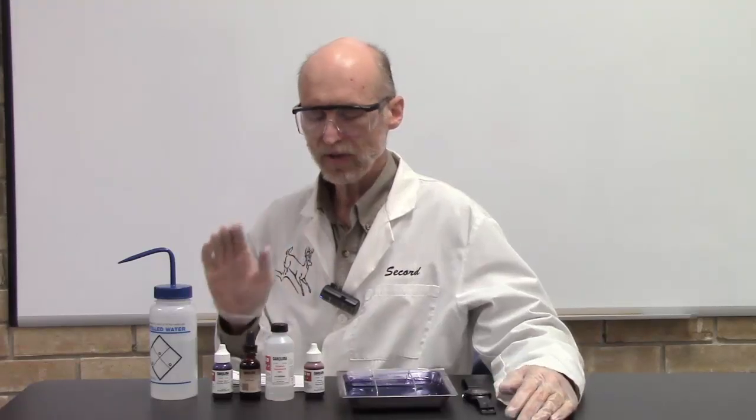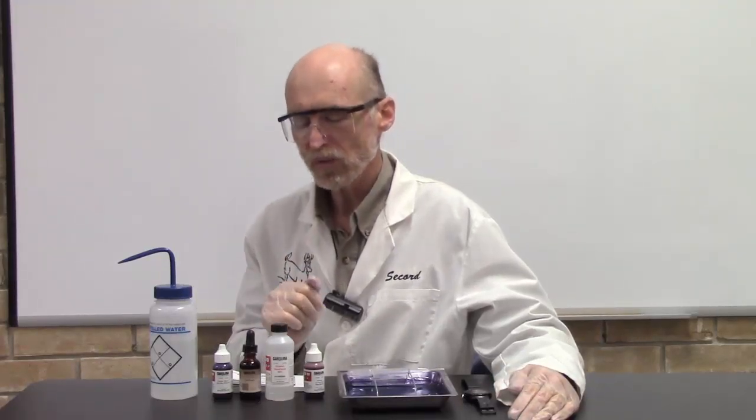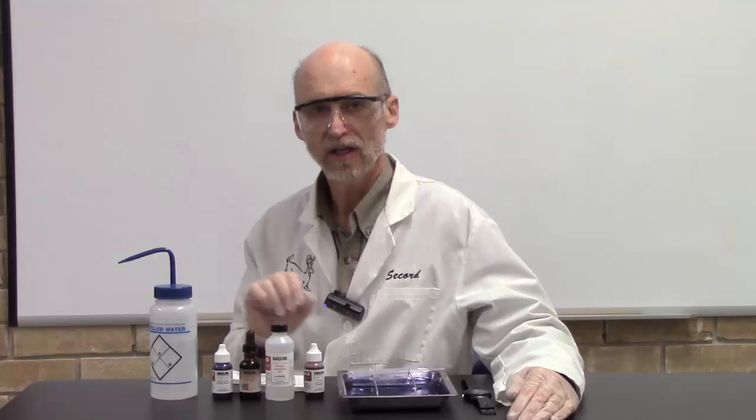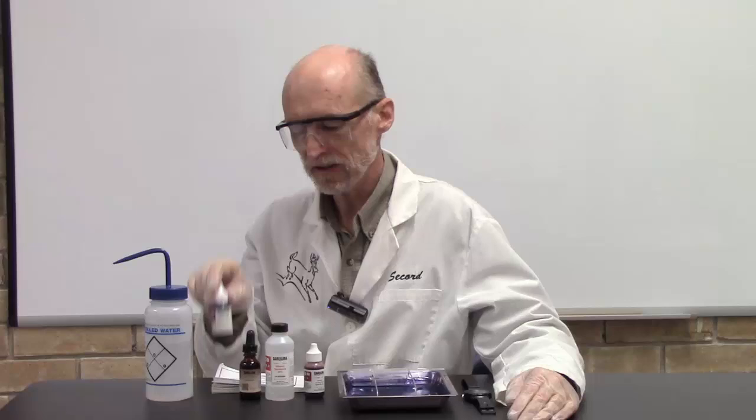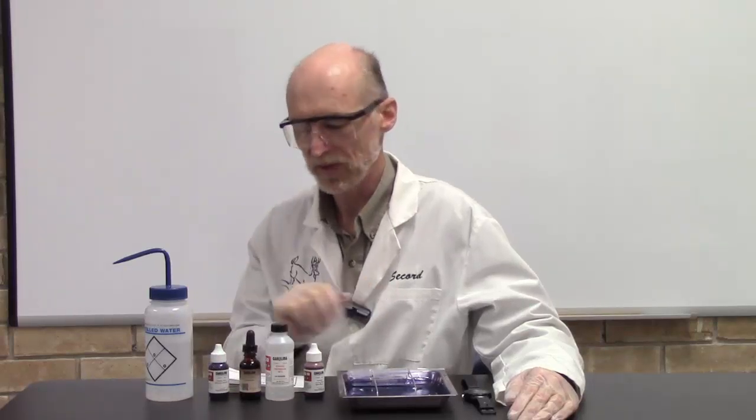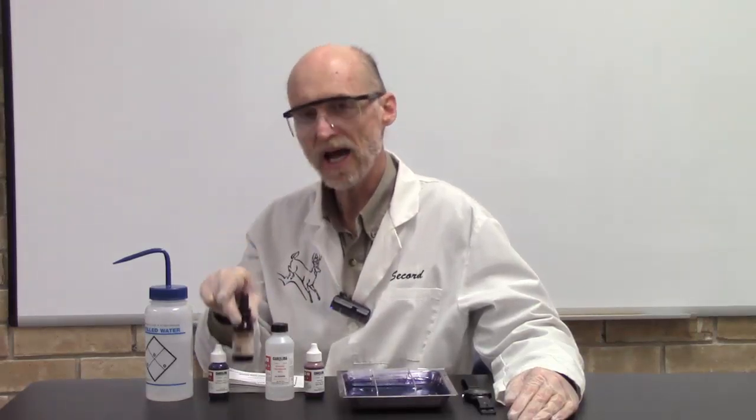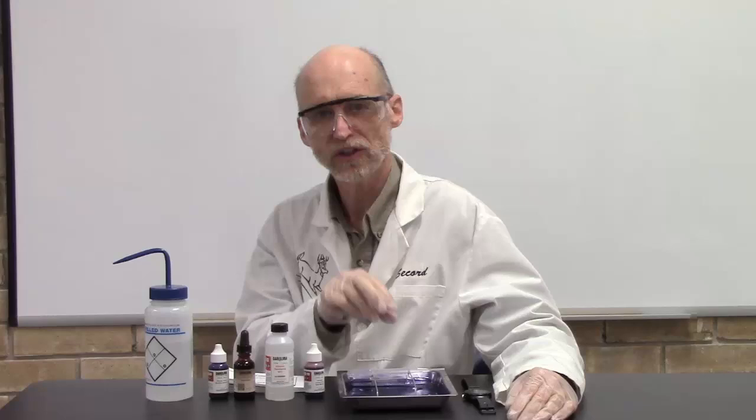Here's the technique. I'm going to describe why we're doing what we're doing and then walk through the technique with you. The idea is to first apply crystal violet to the bacteria to stain them. We then apply iodine, which is called a mordant. It locks the stain in and gives you better penetration and adhesion.